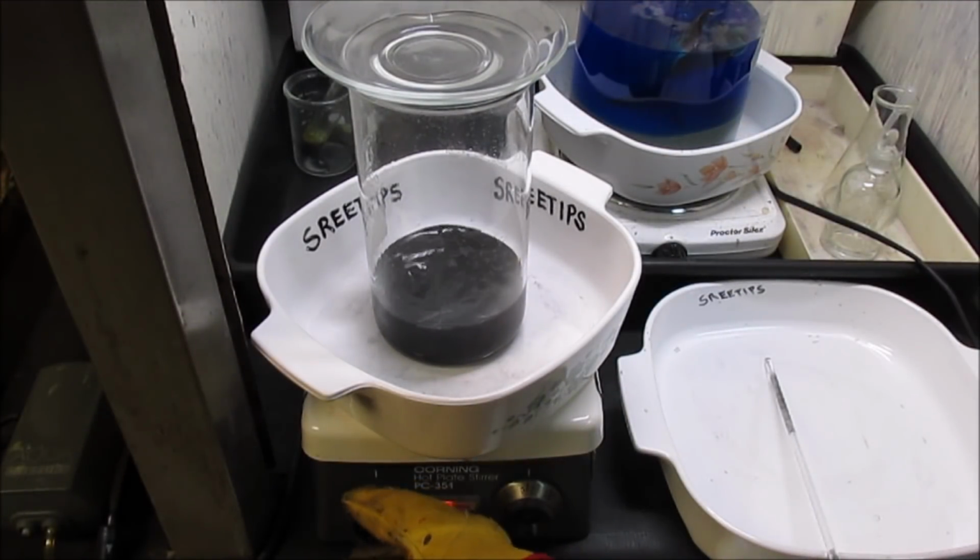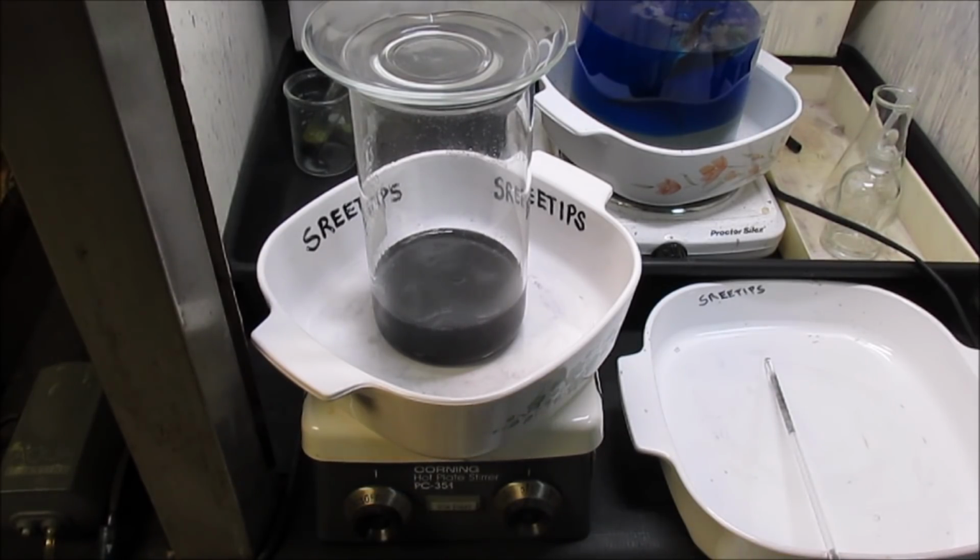Solution's been stirring now for about an hour and a half. I'm going to turn the stirrer off and we'll let this settle and see what we got in that solution there.